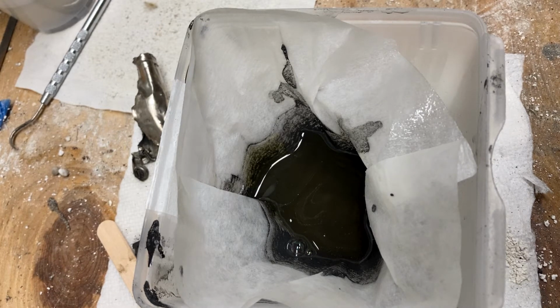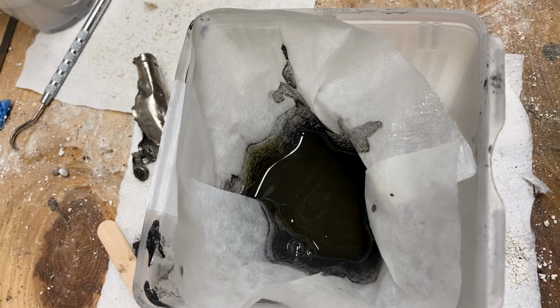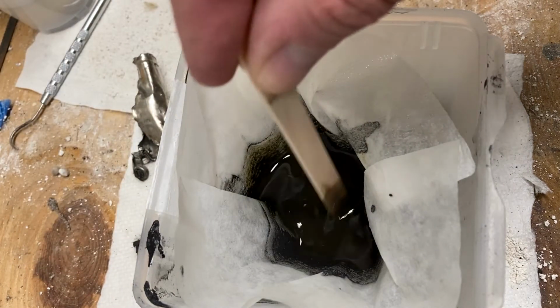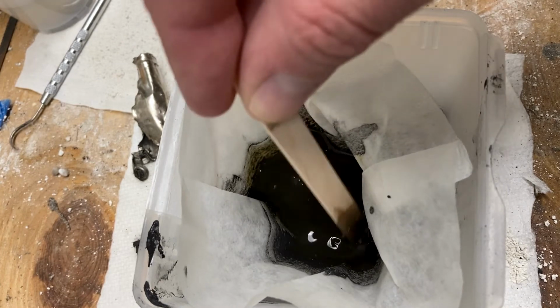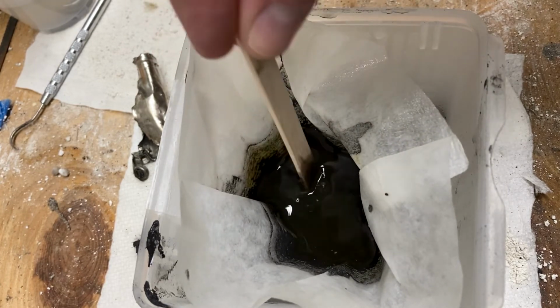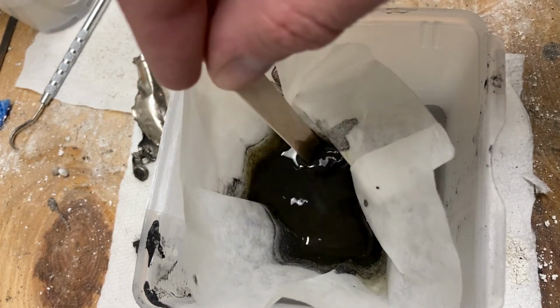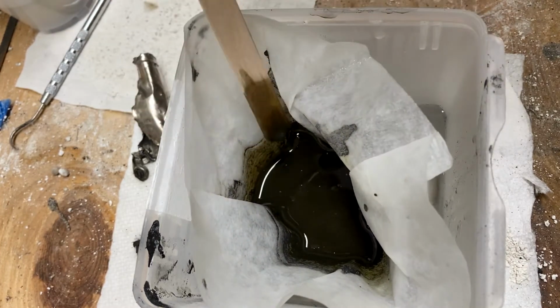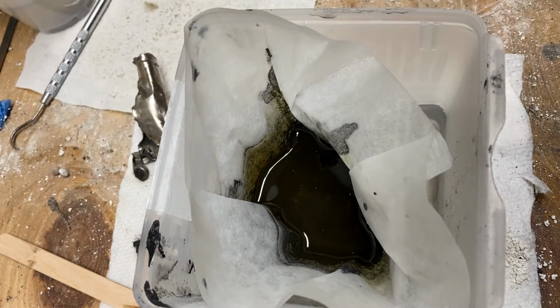The zinc oxide would not bubble because all that's going to do is react with the citric acid. The proton on the acid will react with the oxygen on the zinc oxide and produce water. The zinc, on the other hand, would simply substitute for the proton, and what you'd end up with is basically hydrogen gas. So that's what's going to happen on that. And then we'll just let that go. Frankly, the reaction ought to be fairly fast, but we'll let it sit for a while and see if we can let it diffuse out of there anyways. So I'll give that some more time to just cook there.